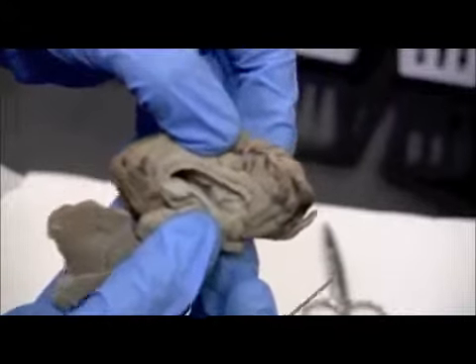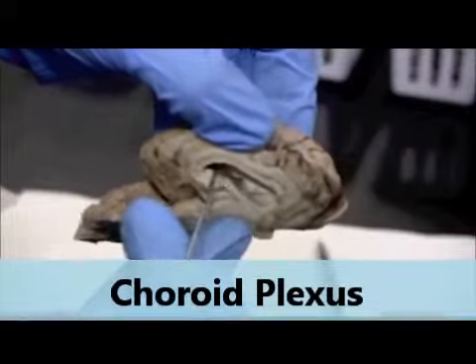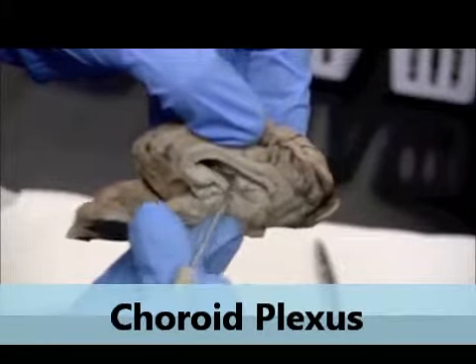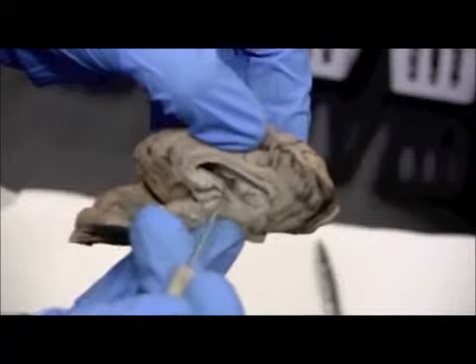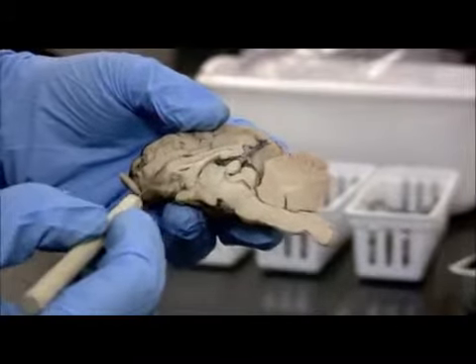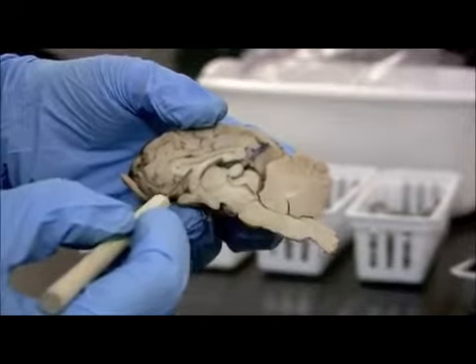That pigmented area, this dark tissue right here, that is part of the choroid plexus. Those are the specialized ependymal cells that produce the cerebral spinal fluid. So you're going to find those in certain areas of the ventricles, and this is a really good example. Here's that other half where we had the corpus callosum and the septum pellucidum in front of the lateral ventricle.